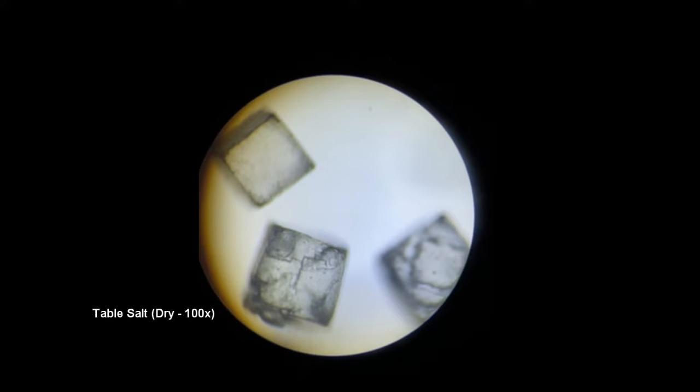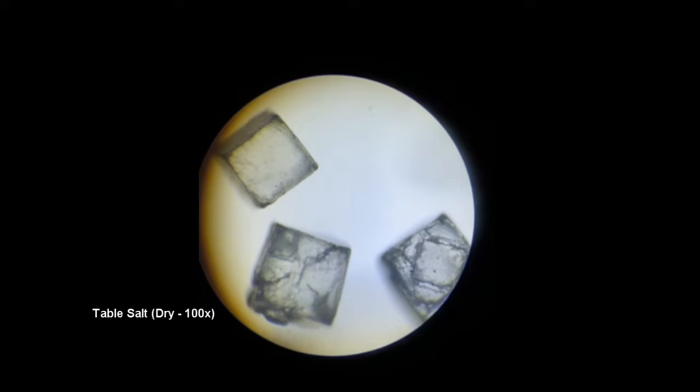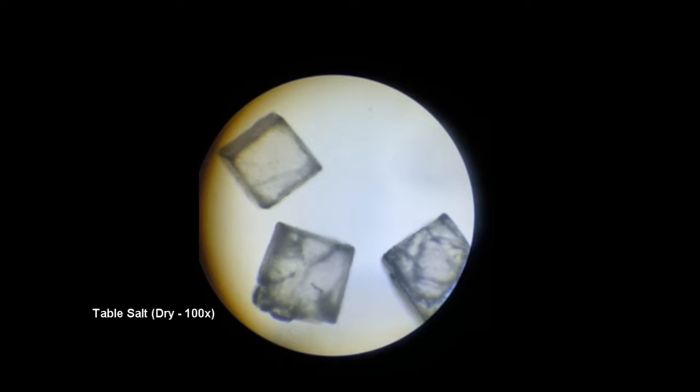In these short clips, I have isolated each of the solids used in the separating mixtures lab. This will allow me to visualize their microscopic characteristics prior to adding distilled water. In the first, table salt, most crystals were near uniform and appeared cube-like.